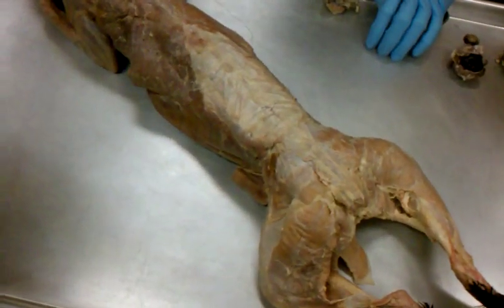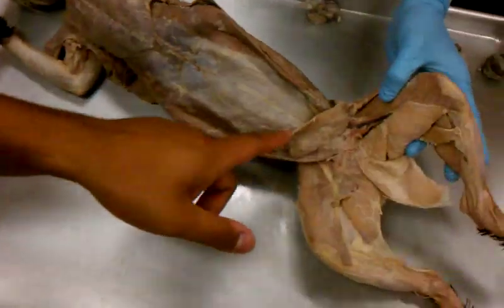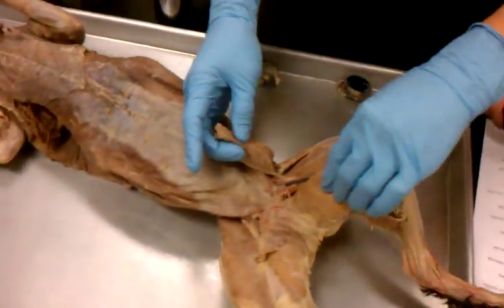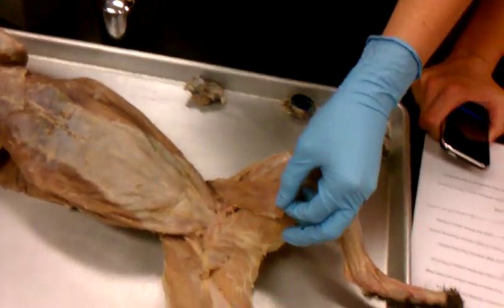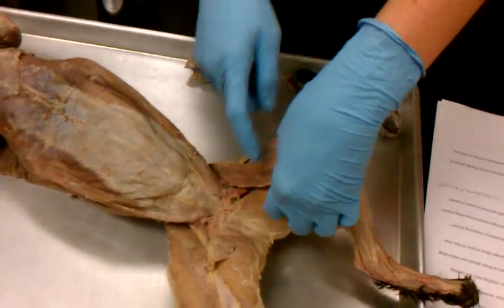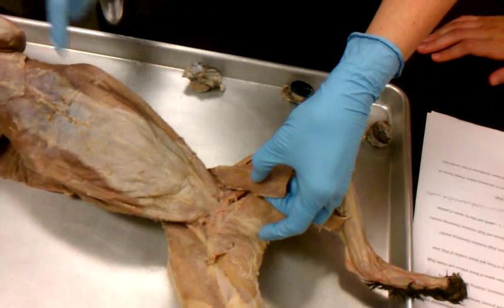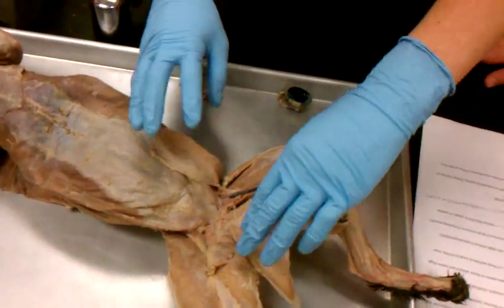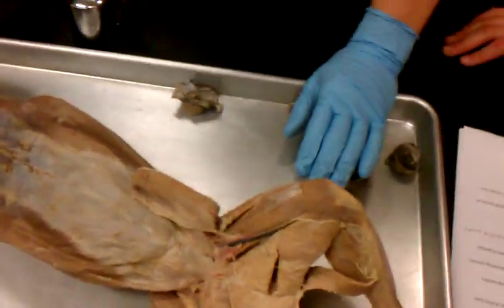I just went blank. All the leg ones? Yeah, you know how you pulled it up? Talking about these things right here. So what we would probably do is I do them on different cats. Probably your TA will have 1 or 2 or 3 cats out, and on one of them will have this closed and maybe pin through the sartorius and have it kind of up like that, and then pin other ones up here. And then if we want to do stuff underneath there, just don't worry about these 2 and just pin stuff underneath there. Okay. That makes sense? Yeah.